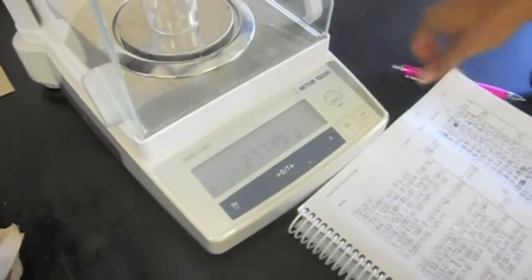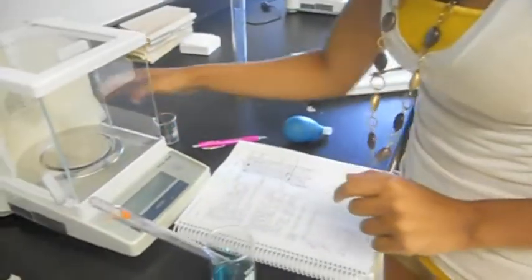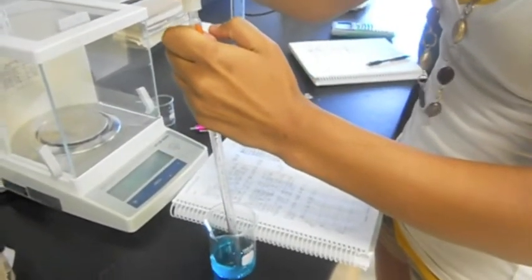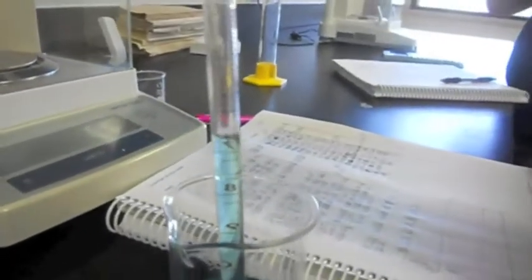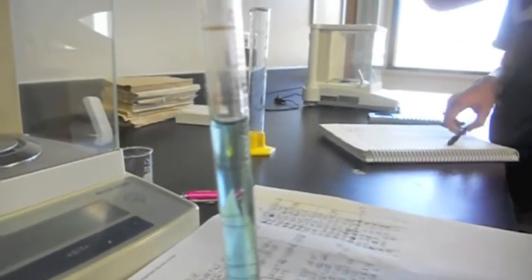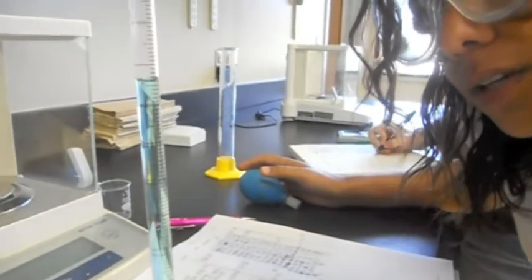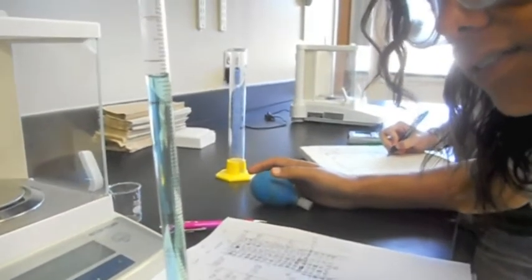Our initial mass is 28 grams. The volume is 5.63.